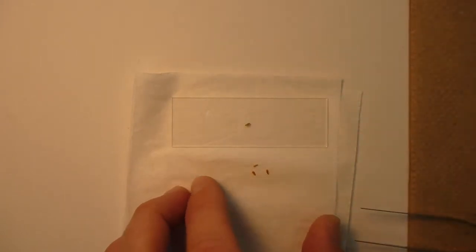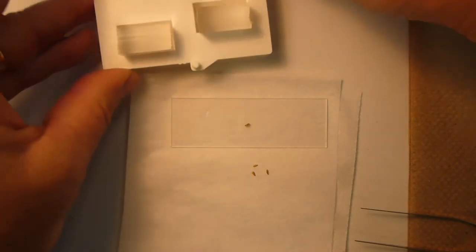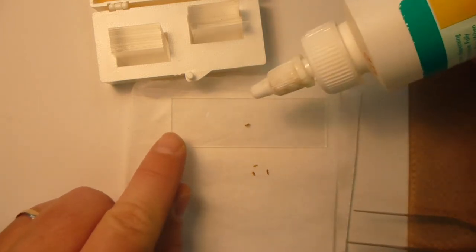As soon as I put the preservative on, it'll kind of go wherever it wants anyway. So the first thing I'm going to do is have my coverslips ready to go, and now that I have a specimen on the slide.